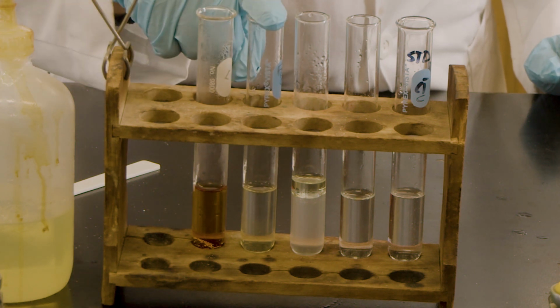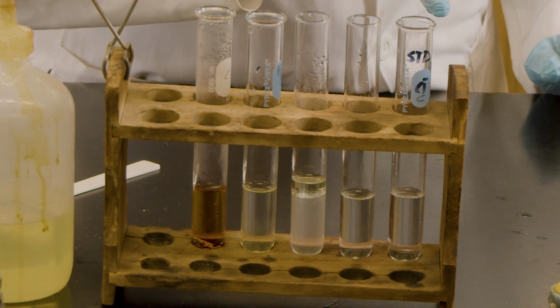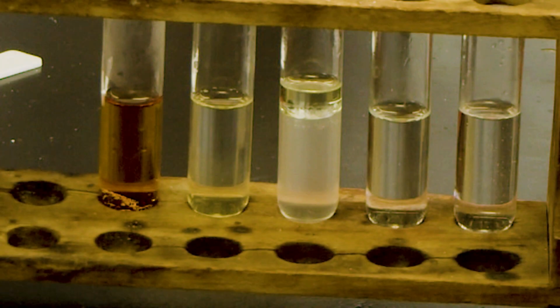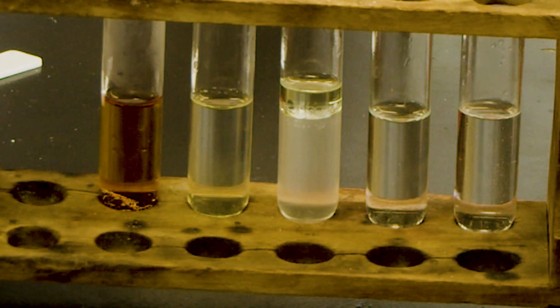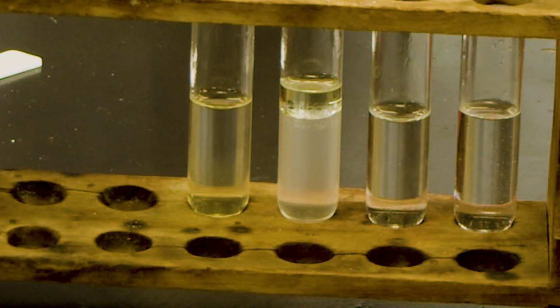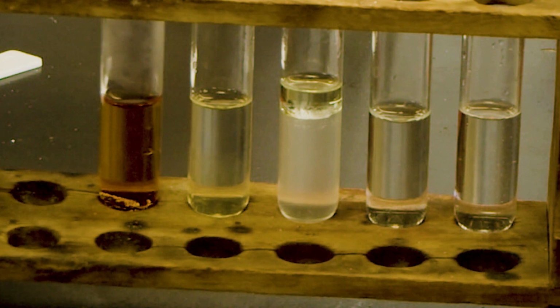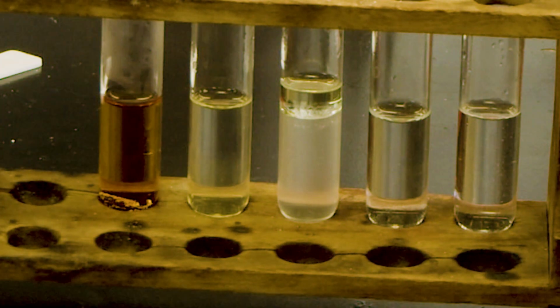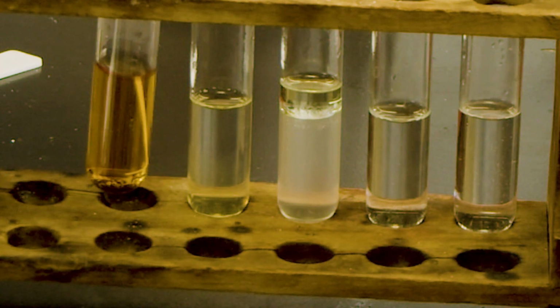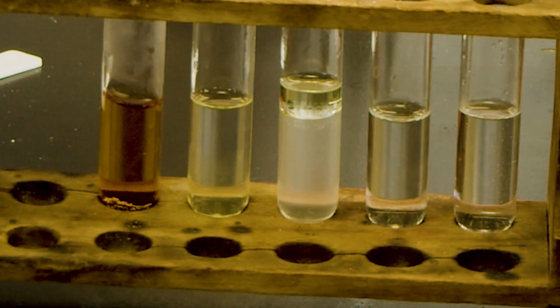And this is an organic compound, guys. This is a mixture of polar and non-polar. So some of them are soluble when you mix with the cold water, and it totally dissolves when you do the hot bath. And this is for the iodine. When it was with the cold water, you could see the chunk, but when you did the hot bath, there's no chunk. It's totally dissolved. So as temperature increases, the solubility increases.